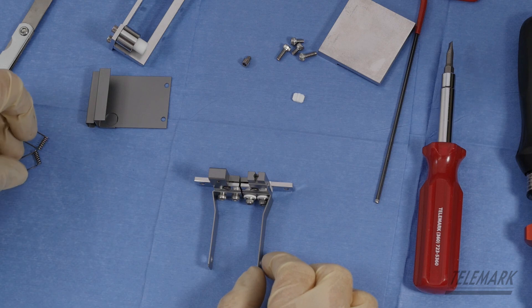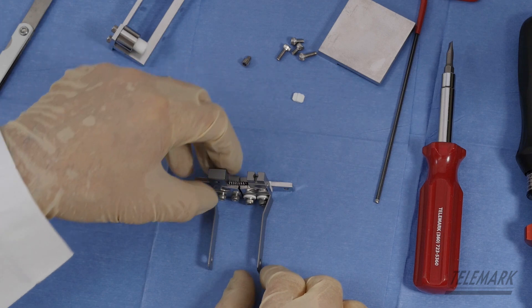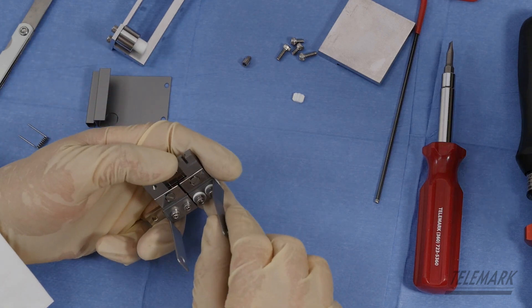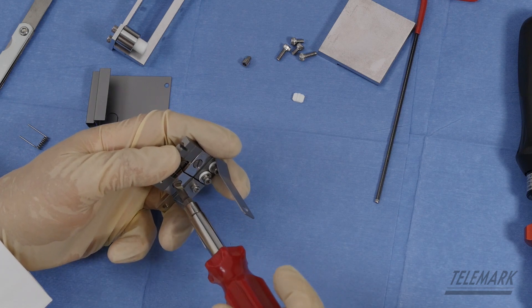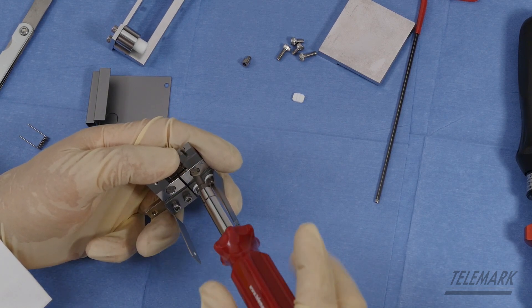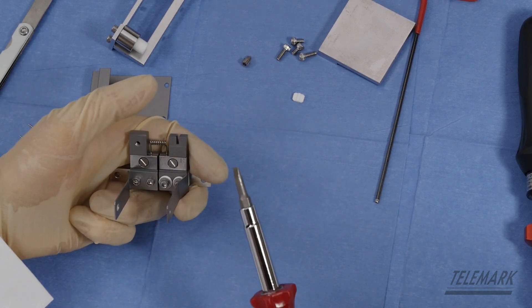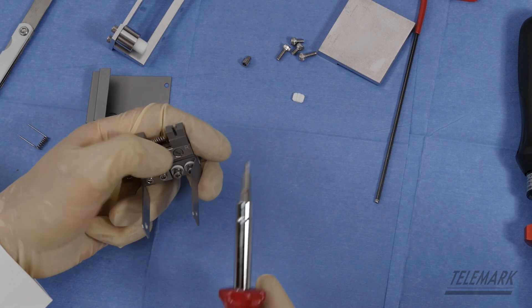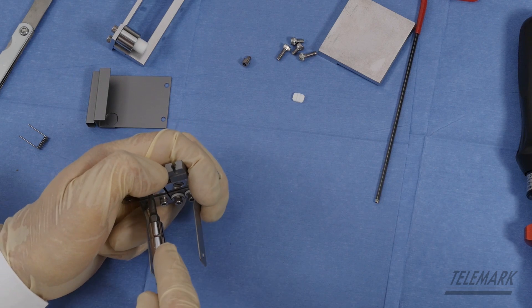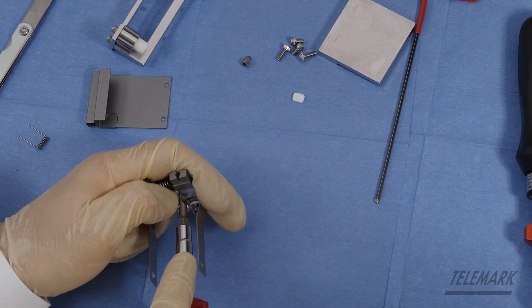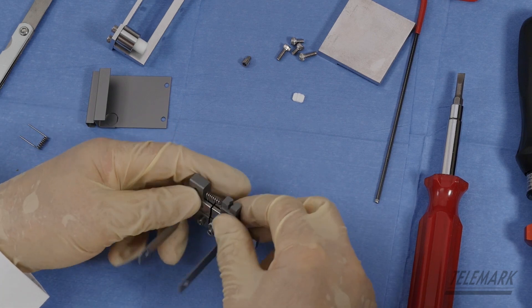And you go locate a 7 1/2 turn filament. Set her down into place. Kind of hold it in position with your thumb. Snug down the left cathode or filament clamp. Snug down the right one. Kind of make sure your position is where it needs to be. And then lock it down. Lock it down. Everything seems to be going too smooth.